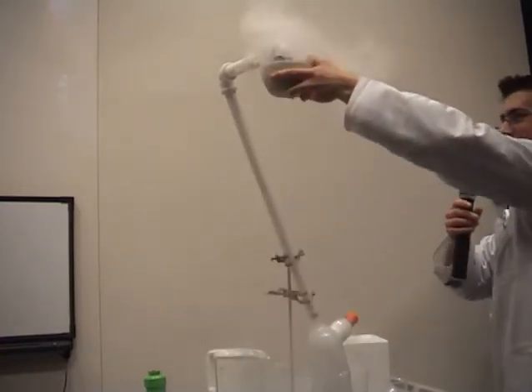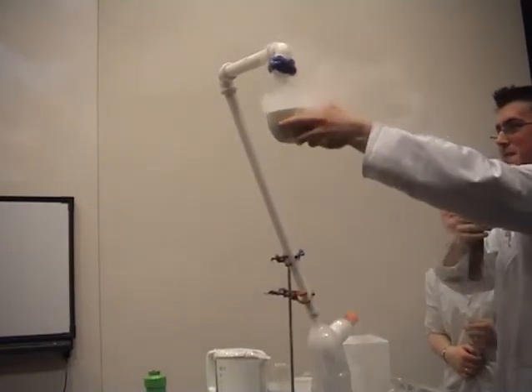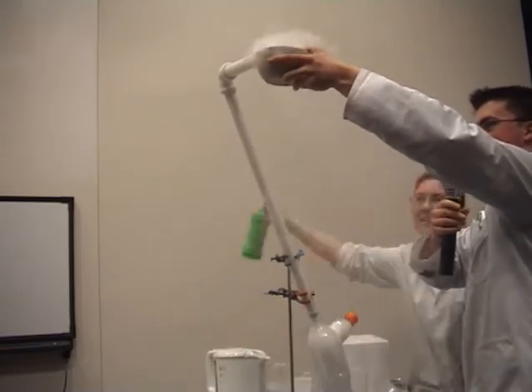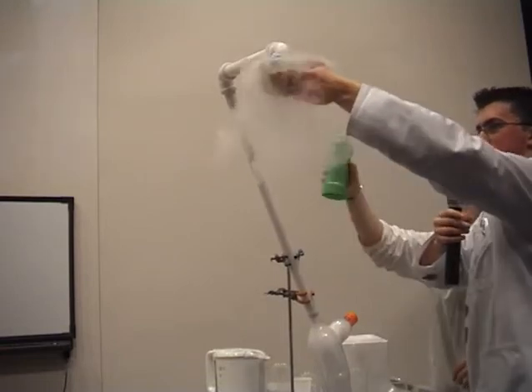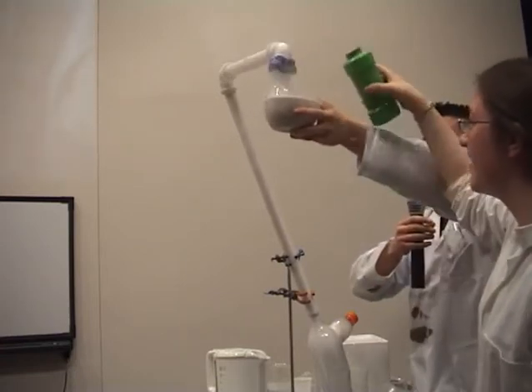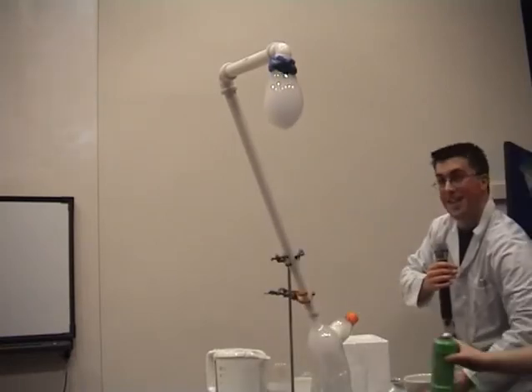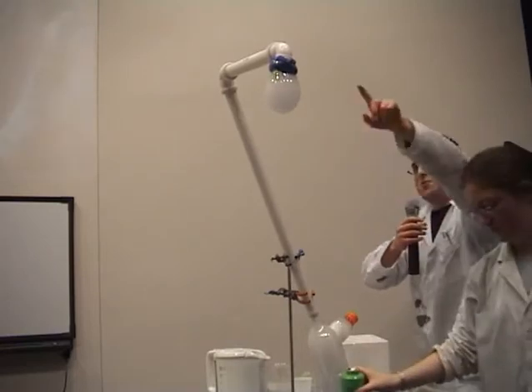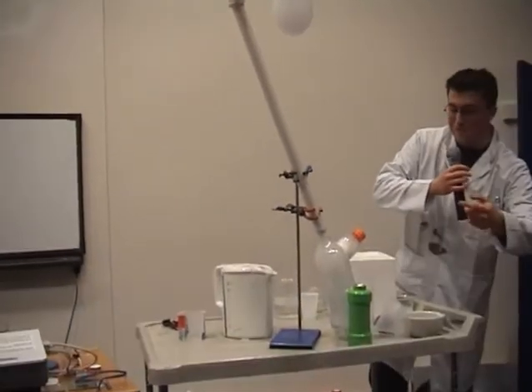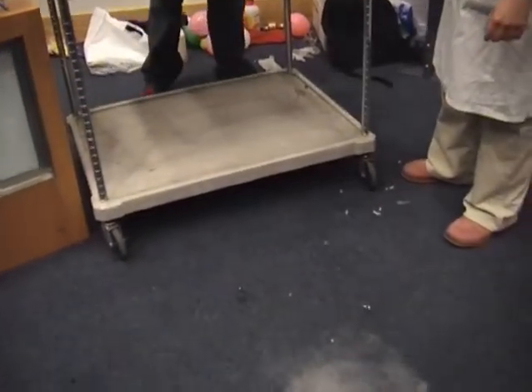Come on, you can do it. So we get a bubble. Nearly. There's too much CO2 going into it now, the pressure's too big. Now, as you can see, that CO2 is coming up through the pipes. We were hoping that would actually happen, we didn't know if it would. Right, the CO2 is going up into the bubbles, and I'll hand you over to Fiona to describe it.